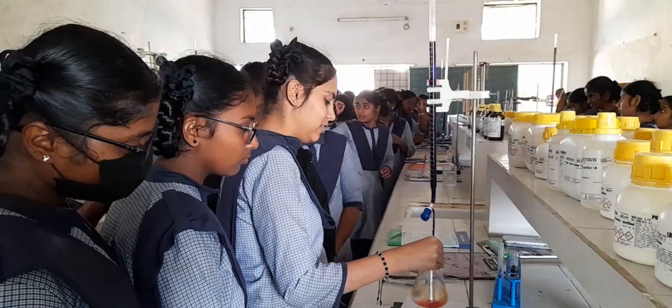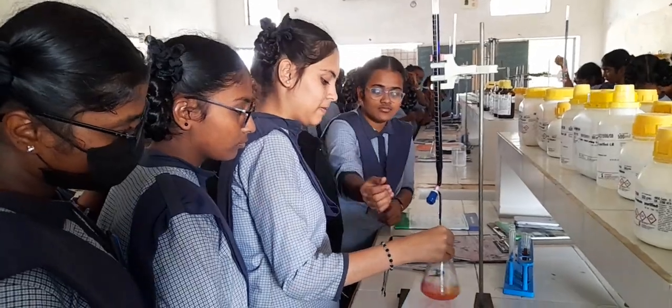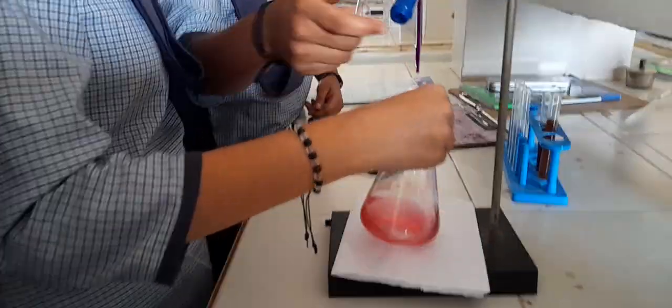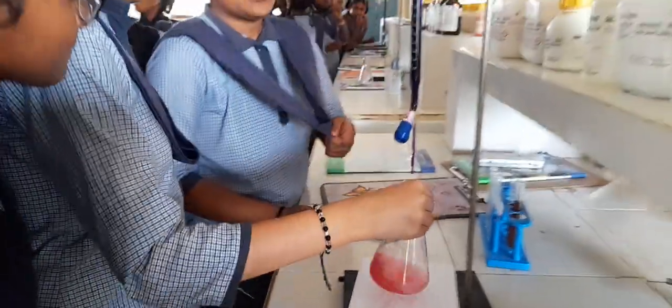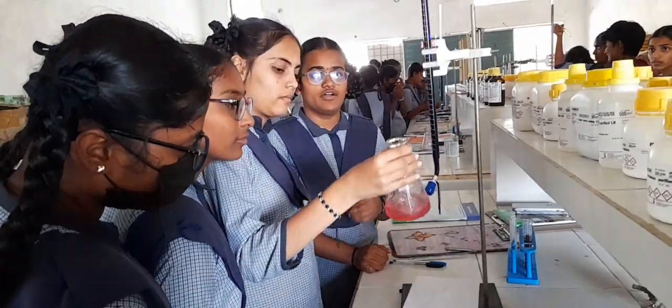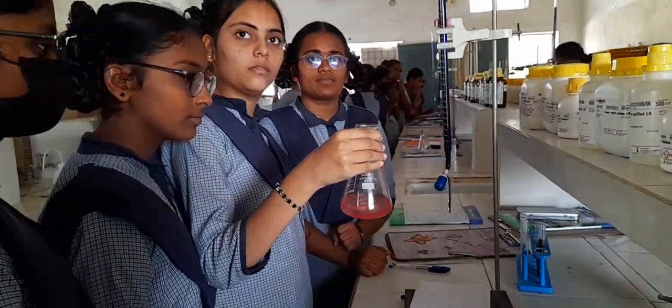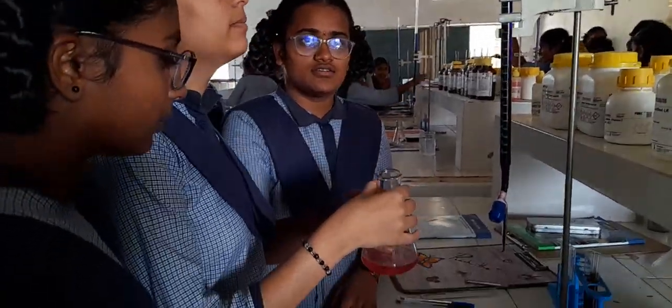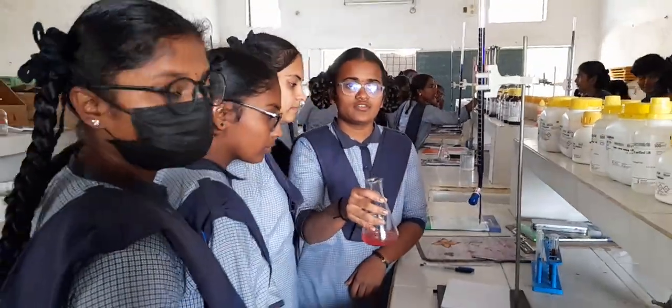Okay. Done. We have Ishwarajal and group here. Tell me, children, what is your practical about for today? It is about potassium permanganate against ferrous ammonium sulfate, ma'am. You got your end point. Yes, ma'am. Pink color. Yes, that is your pale pink color. Very good.